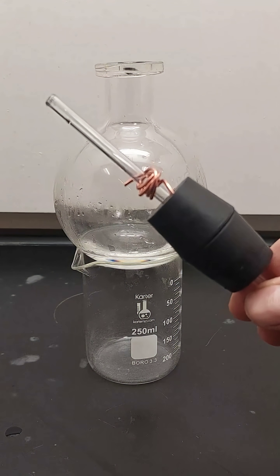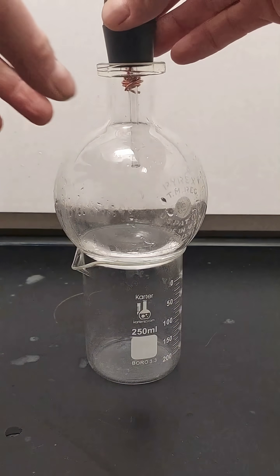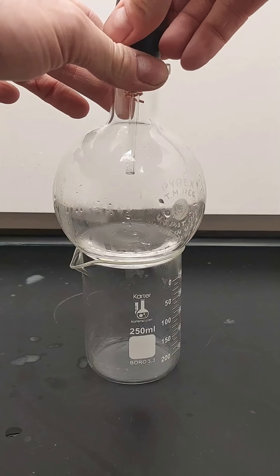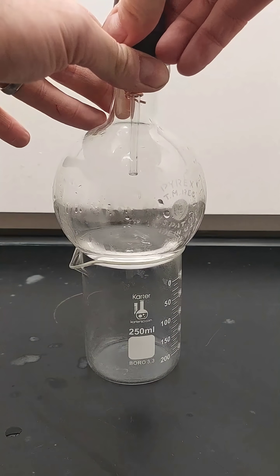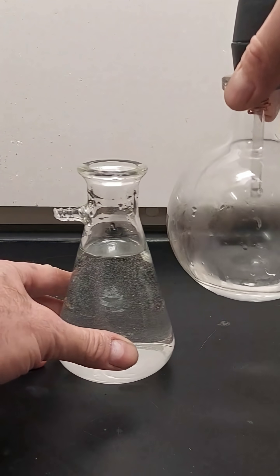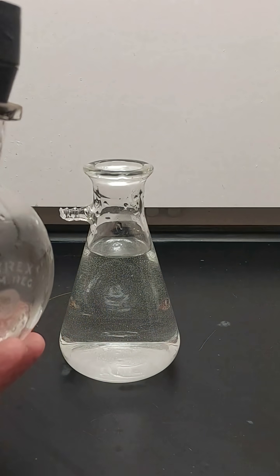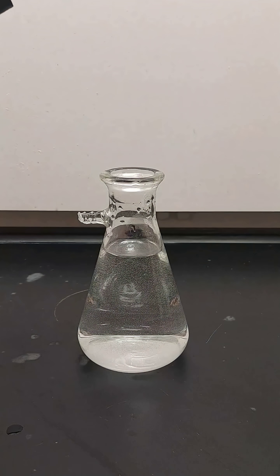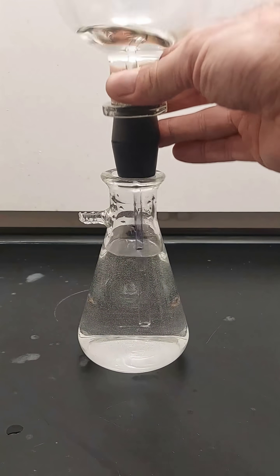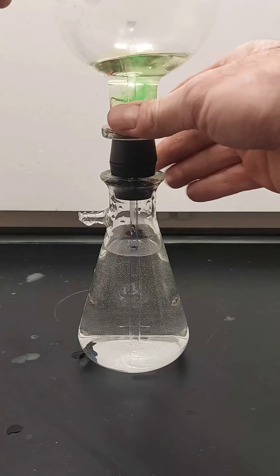Once they come into contact, they will react vigorously to create deep blue-green copper nitrate at the bottom of the upper flask, as well as a brilliant orange-brown nitrogen dioxide gas at the top. The gas builds up and is able to displace the air in the flask until it bubbles out of the bottom flask.